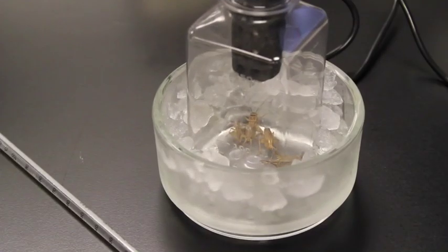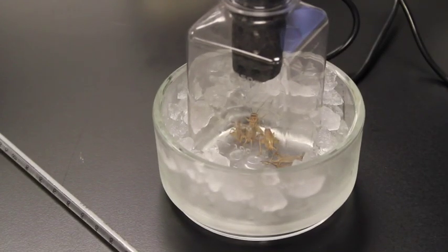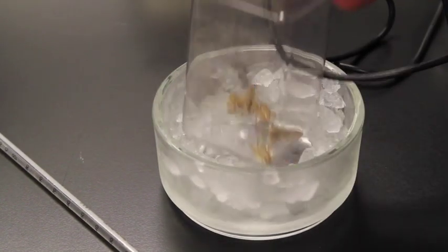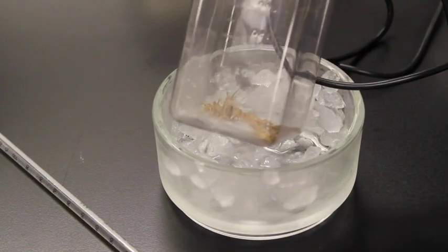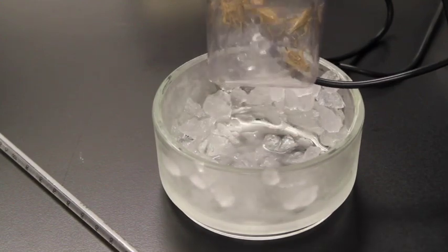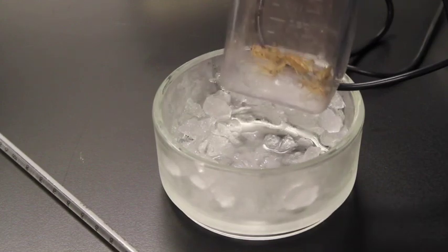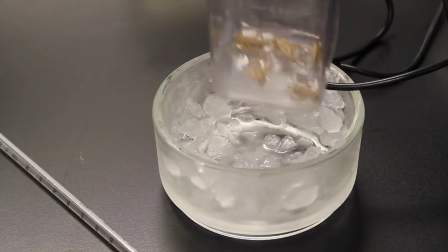Okay, we should also just make a quick observation of what's happening to our crickets. And so we can open this up, right? Take our crickets off, and we can look at our crickets here. So our crickets aren't moving very much at all. They're pretty much kind of there. They're not really dead, they're just in a torpor.